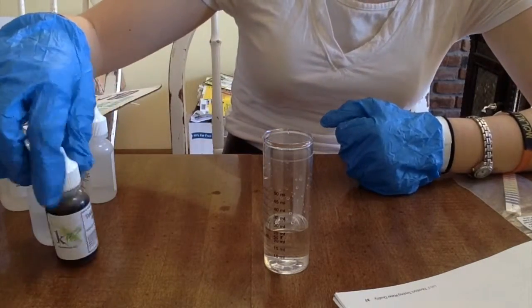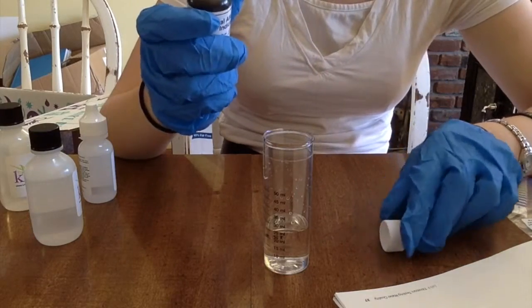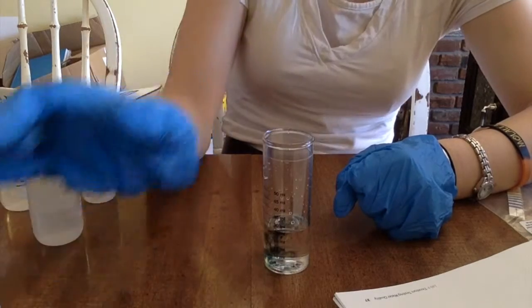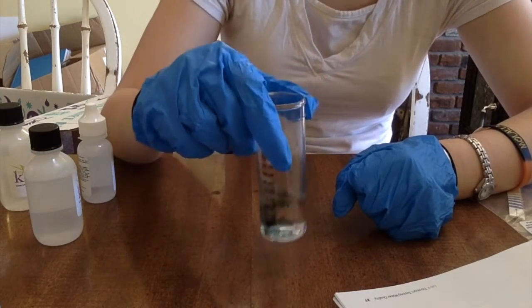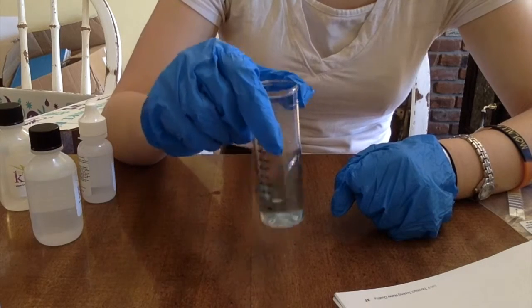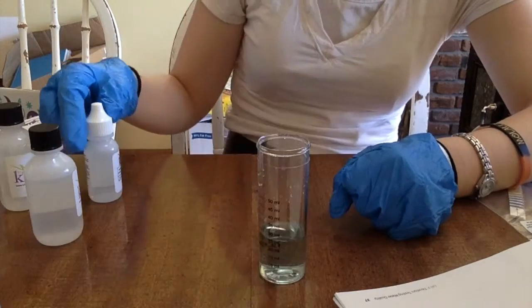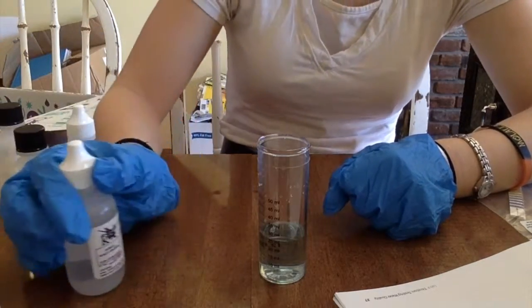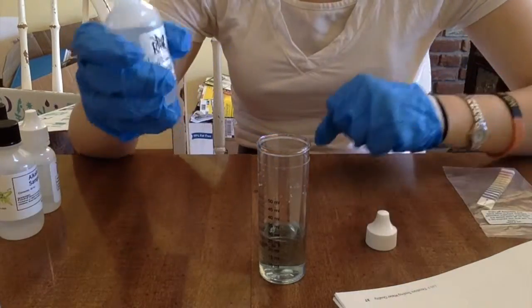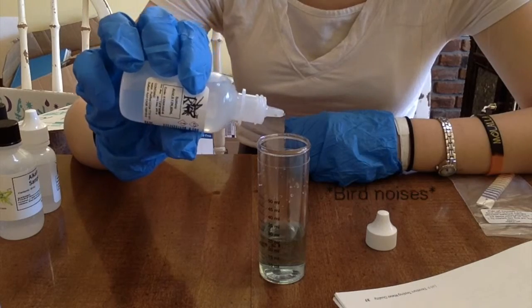Add three drops of the total alkalinity indicator. It will turn red when the pH is 4.5. Three drops: one, two, three. Look at that, it's beautiful. Swirl to mix. The sample should turn green. Add one drop of the original alkalinity titrant low, which would be sulfuric acid again. Then swirl, observe for color change — it's green right now. Add the next drop, count the number of drops until the color changes completely from green to red. So green — it's Christmas.